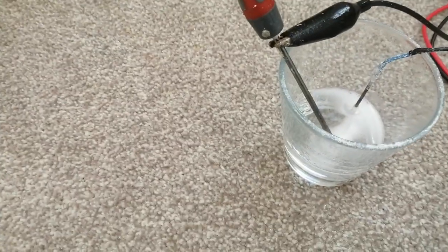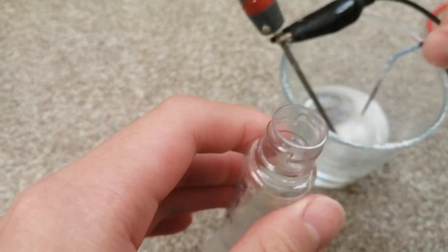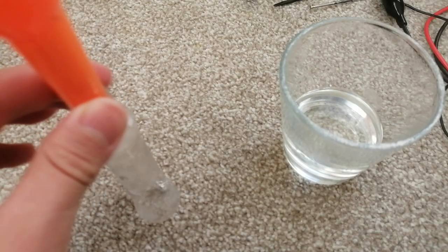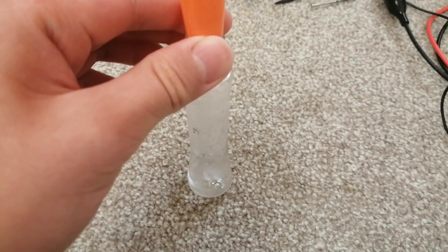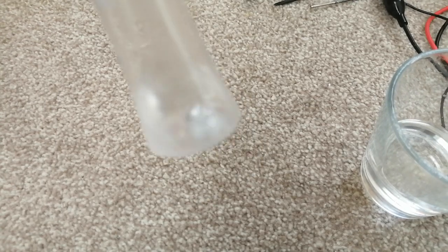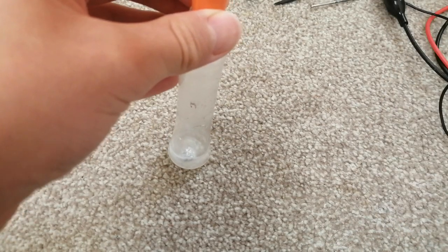In order to test this is sodium hydroxide, I'm going to use a bit of aluminium, roll it into a ball, and stuff it into a little bottle. Stop the electrolysis right there. Be careful — the solution is caustic right now because it's sodium hydroxide. I have a funnel. If you look carefully, the aluminium ball will start to fizz, as you can see there. Soon the aluminium will get dissolved away because the solution is highly caustic.